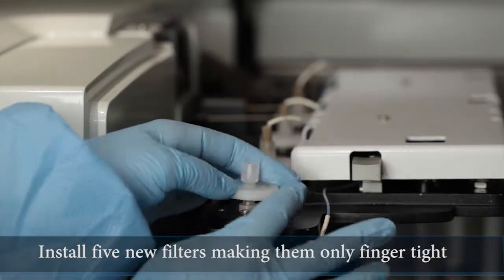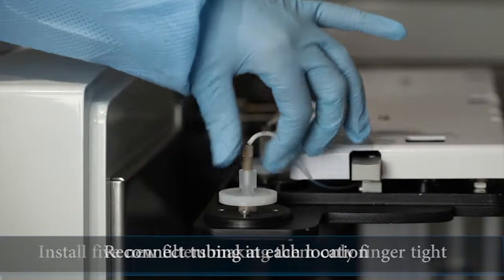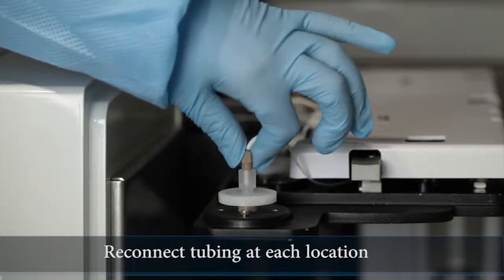Next, install five new filters taking care to make them only finger tight and to not over tighten, reconnecting the tubing at each filter location.